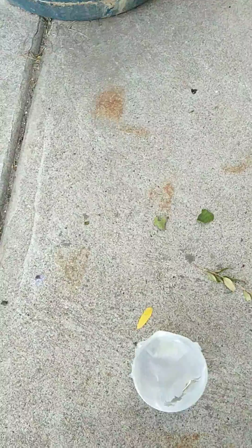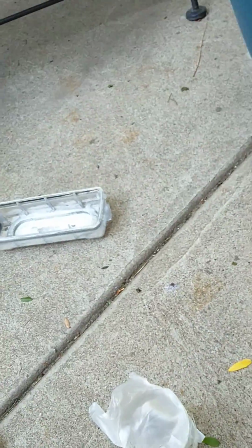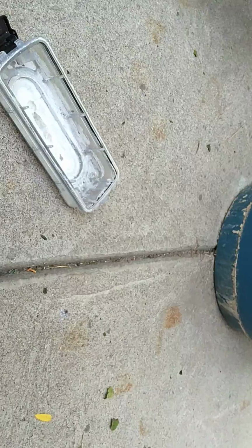I got methylene chloride from an undisclosed location, and I'm going to mix that with bleach and see what happens. If you mix acetone and bleach, you can make chloroform, but I don't know what this will do. Let's see. Could be dangerous.